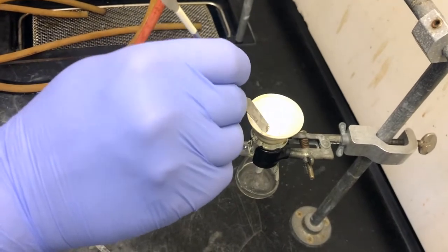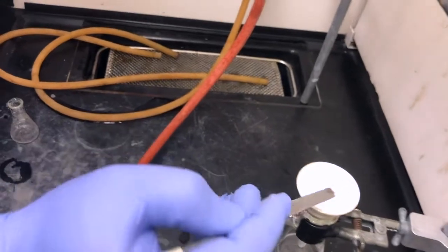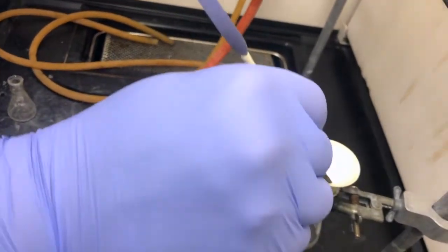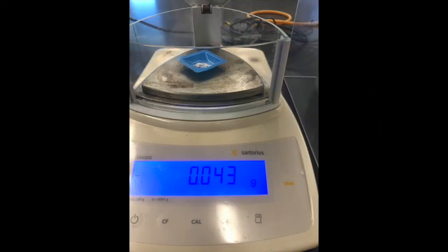So then you just carefully divide the crystals into small pieces and let air get pulled through them. Once we have our final crystals, we take our mass, only 43 milligrams of product. Take a melting point. There's the melting point right at the melting point, 159.5 to 161. So they were fairly pure, but we didn't get many of them.